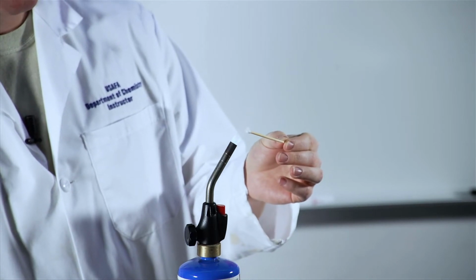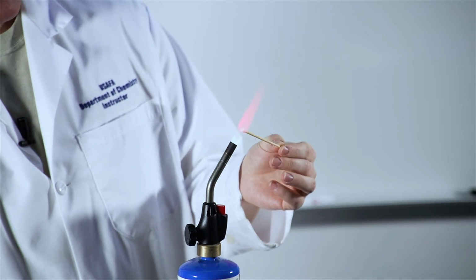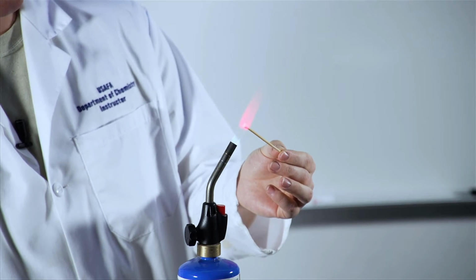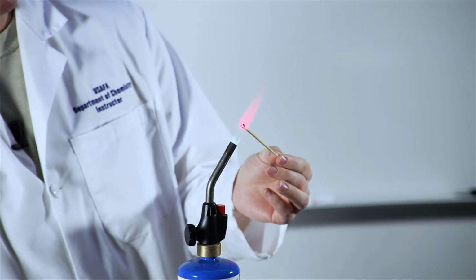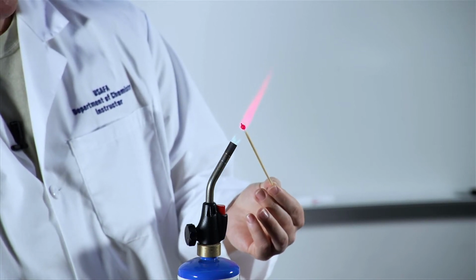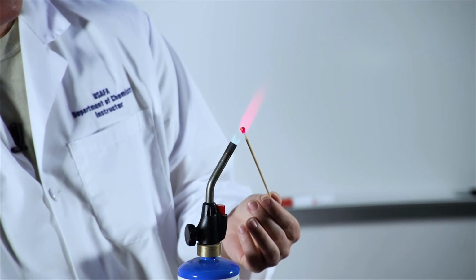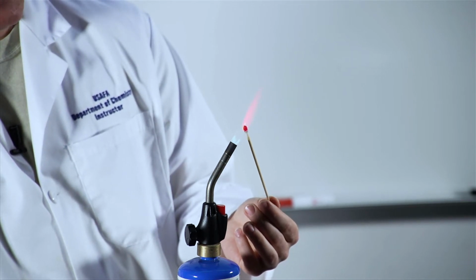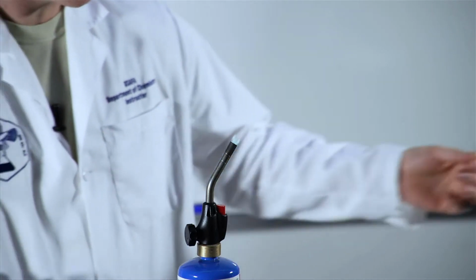When I do that, you'll start to see this sort of red, kind of violet color emitted from there. And that is inherent to the fact that we're putting energy into our metal, and as those electrons relax, we get an emission. That color is sort of this red color we see. The little bit of yellow flame that you see in there is actually from the Q-tip burning. So sort of ran out of juice here. Let's move on to our next salt.